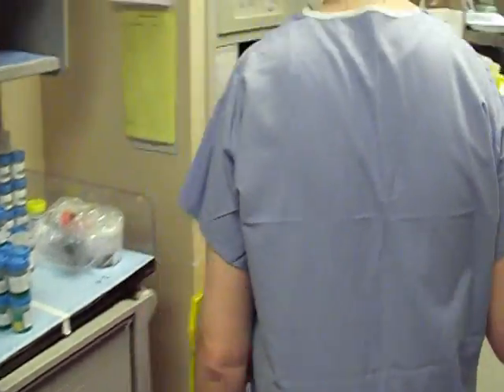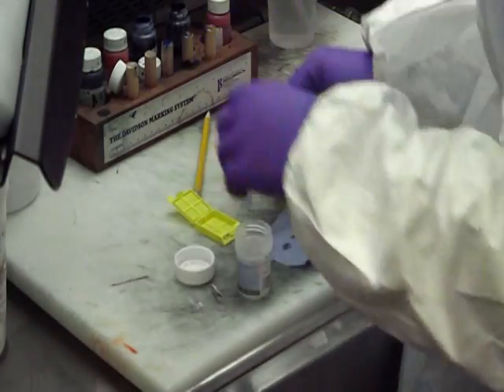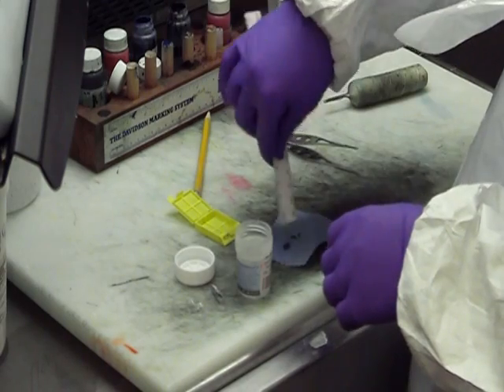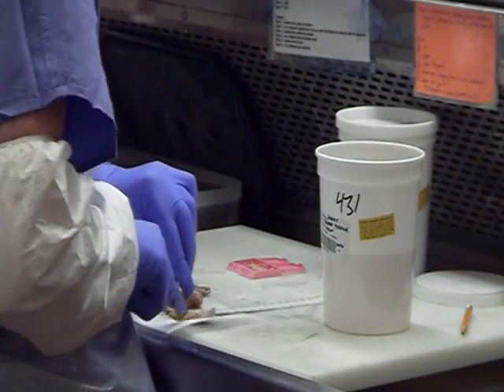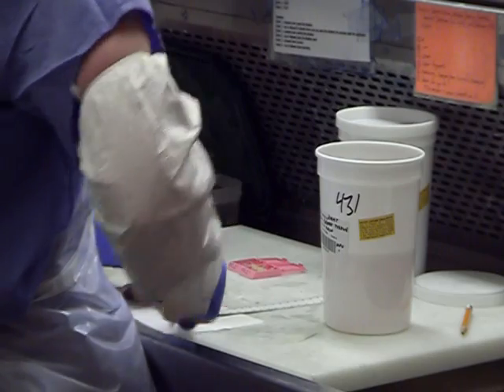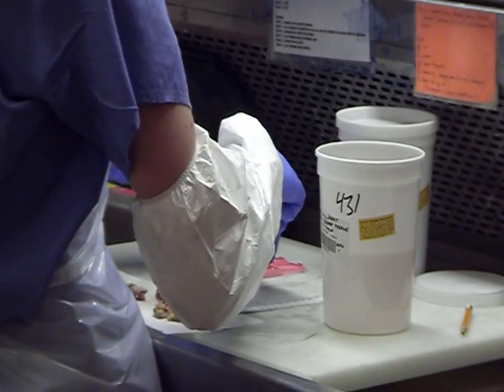A pathologist assistant will gross in the specimen next, dictating information such as the patient name and physical characteristics of the specimen. The specimen is then placed into the cassette or cassettes.